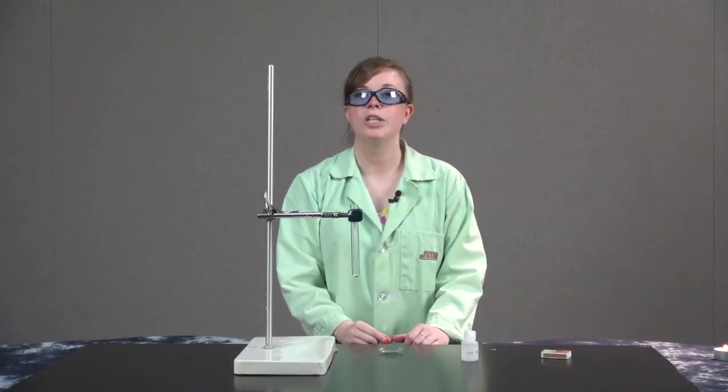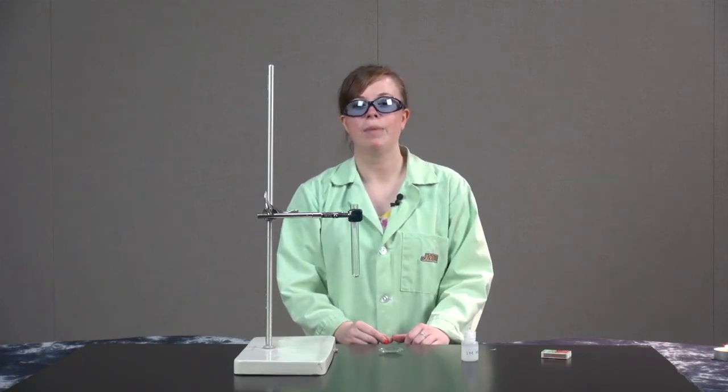Hi, I'm Casey Rogers and I'm coming to you today from the Department of Chemistry and Biochemistry at James Madison University. The demonstration I'm going to show you is called Bubbling Magnesium.